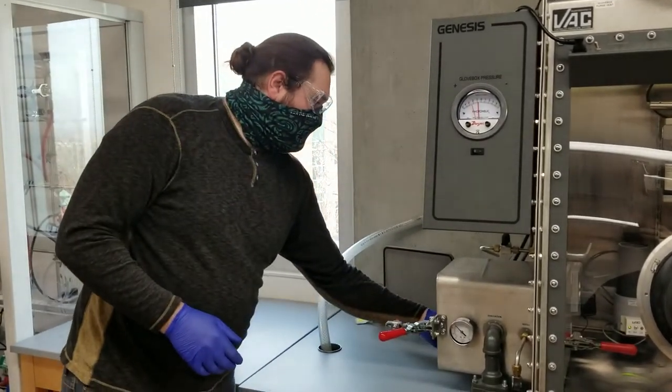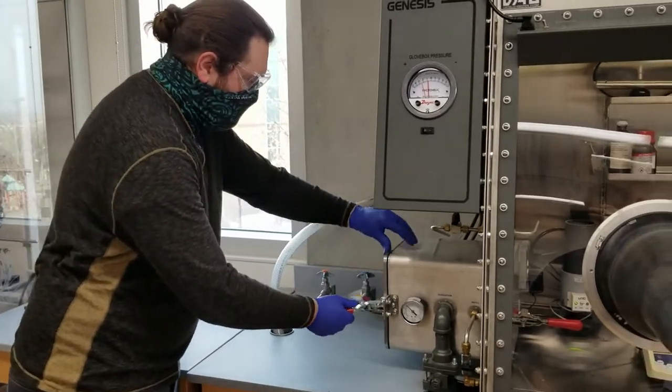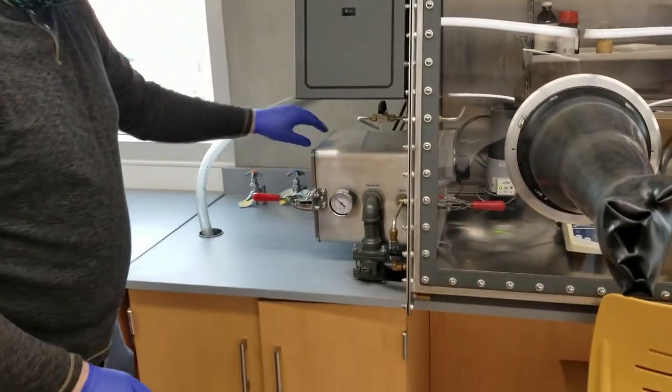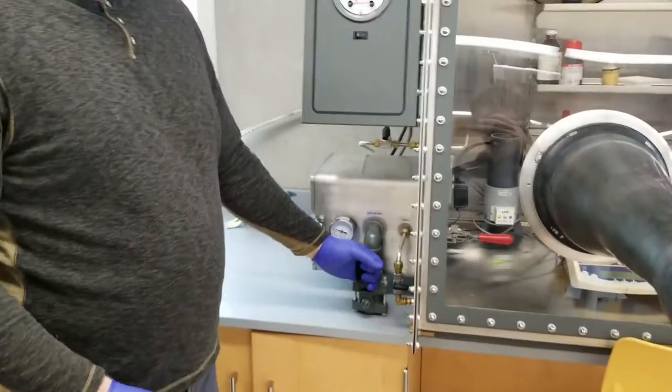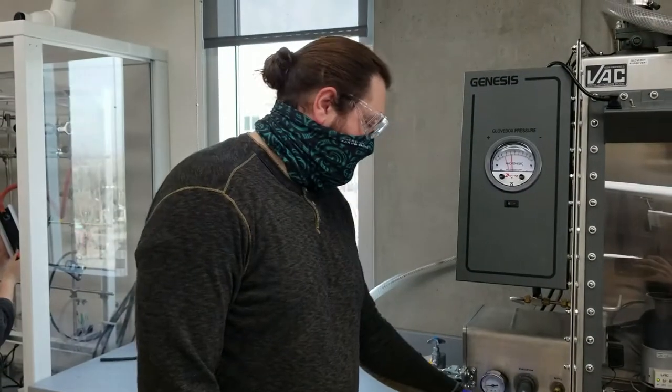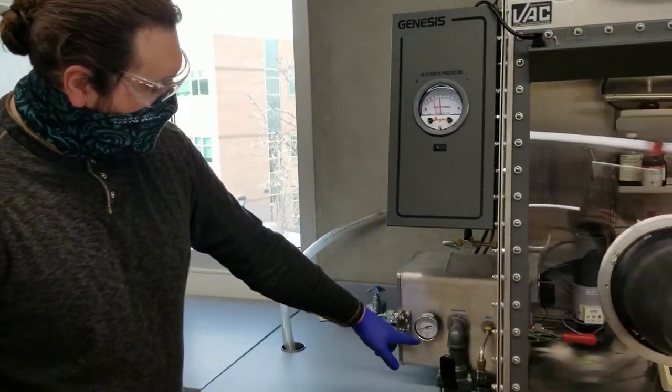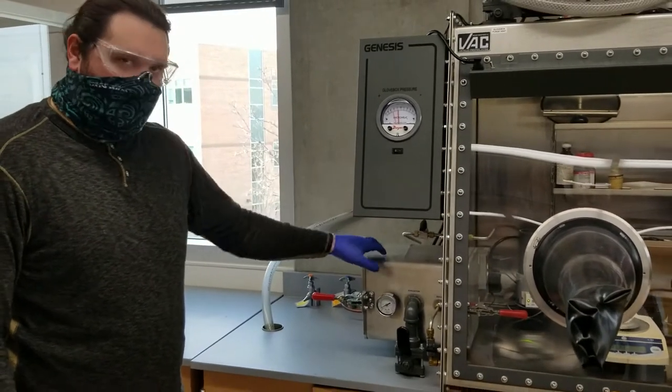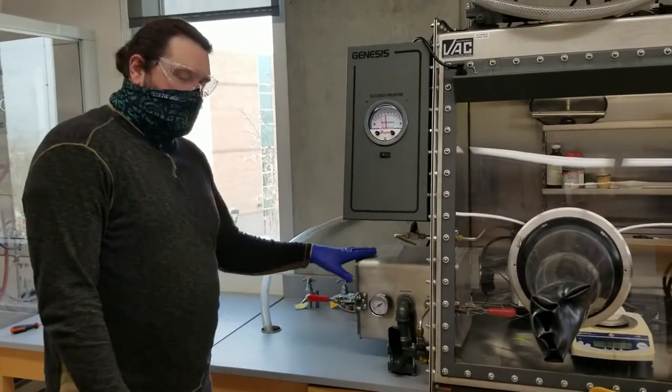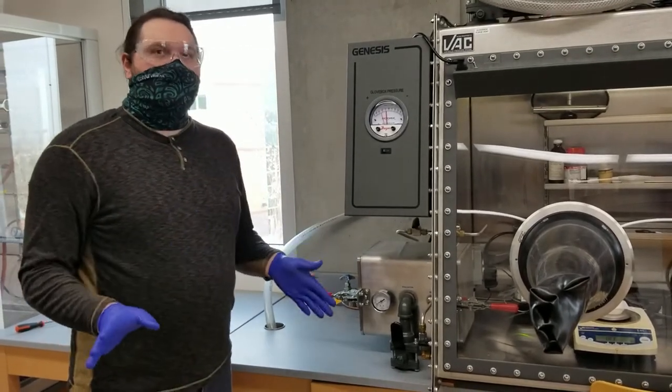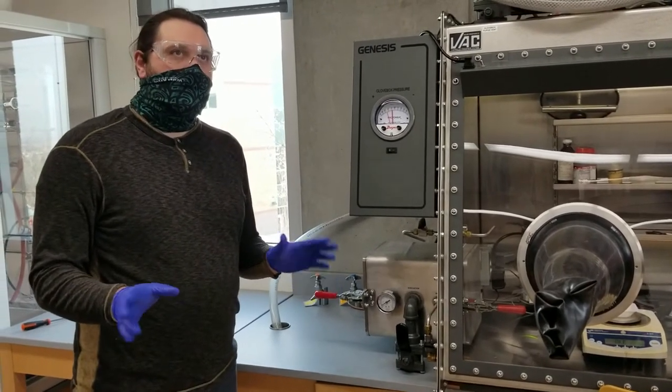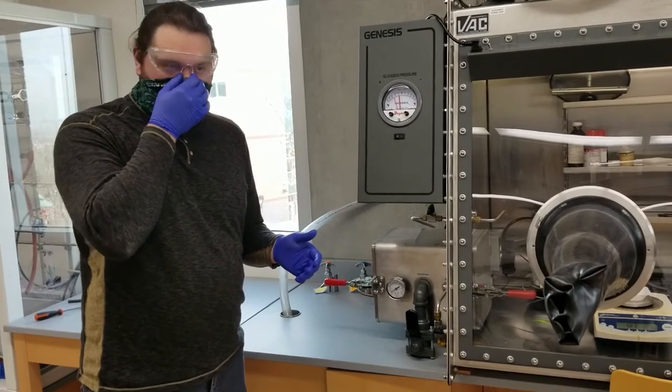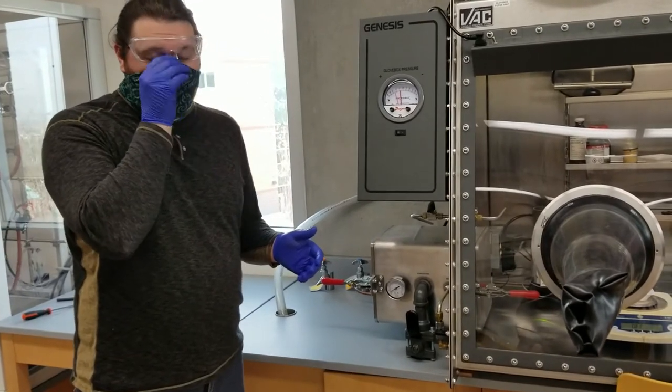So now we're going to take this, we're going to put it in, shut it, lock it, and then we're going to initiate the vacuum. It's going to suck down, get down way, way low. You'll hear it because it stops sucking because it reaches an equilibrium. And once it reaches that point, you're going to leave it for like probably six minutes, two to six minutes. You're just going to leave it. You're going to obviously leave it for longer too.